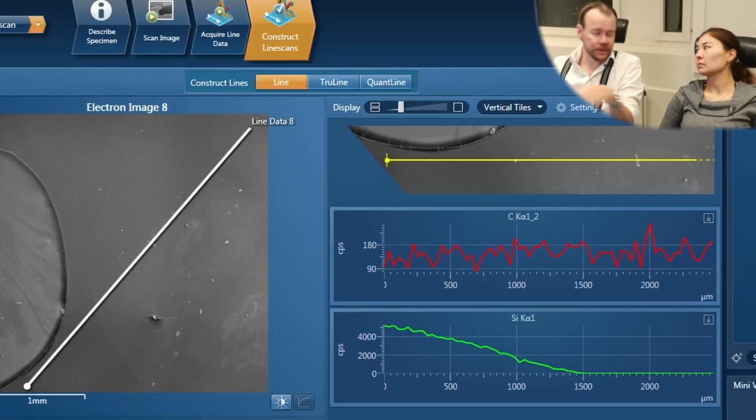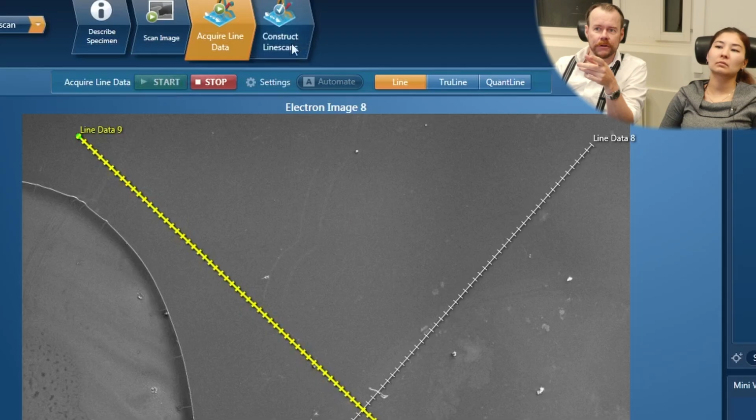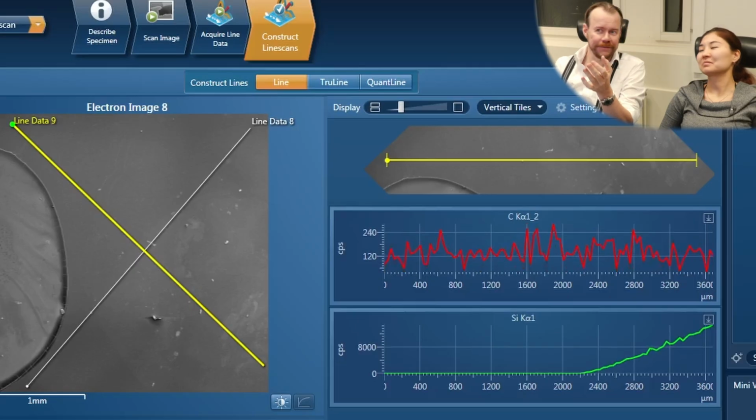I see. So we know that since it's a silicon chip, it should be like 100% silicon everywhere. Yeah. But we see a major gradient here. We can change the scan direction also. Let's try scanning orthogonal like this. You see, then we get the similar effect in the other direction. So it depends on where we are versus the detector. So this is a complete artifact. And if you're doing long scans like this, it's very easy to fool yourself. You think that the concentration goes down with the material you're having or something like that.